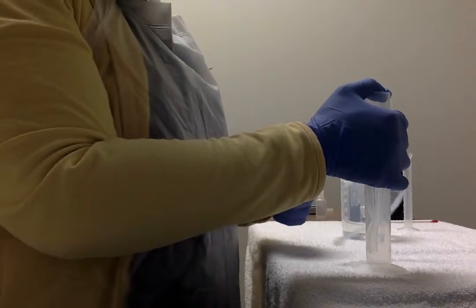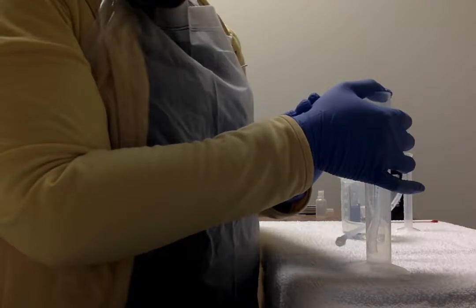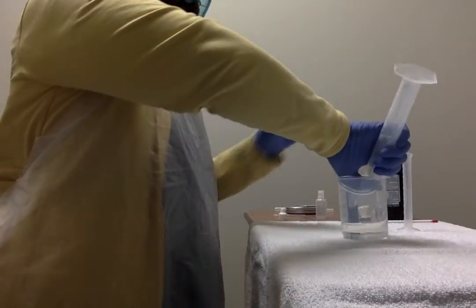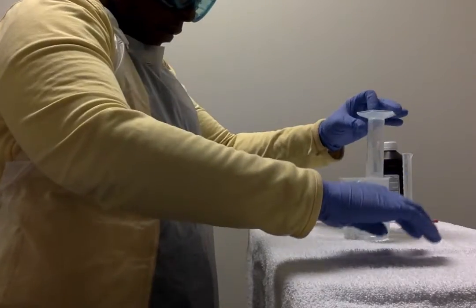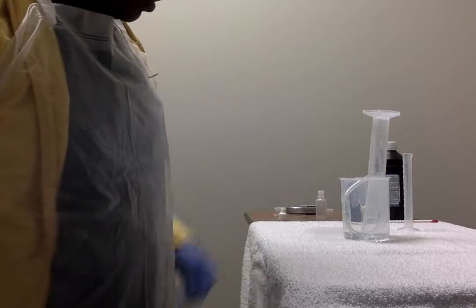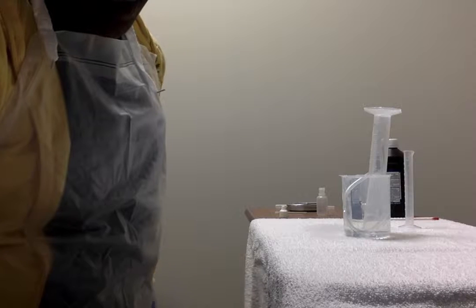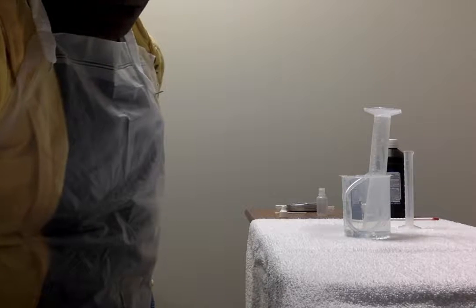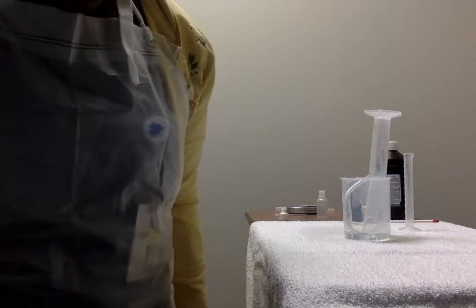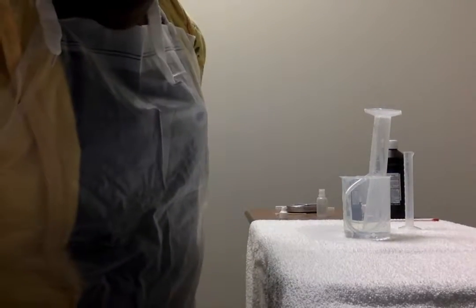And then we're going to place our thumb over the opening of the 50 milliliter graduated cylinder and invert it into the beaker. So basically our thumb's there. Again, we may spill some water, and there we have it. So we did get a little water spill out. It cautioned us on that. And it says record the initial volume of gas in the graduated cylinder in data table 1. So right now there is no gas. It'd be fine for us to put 0.